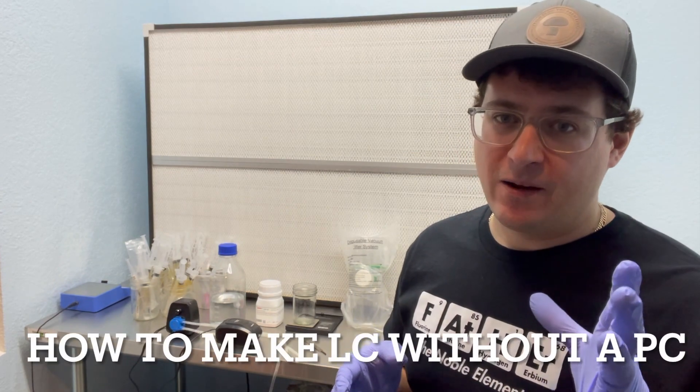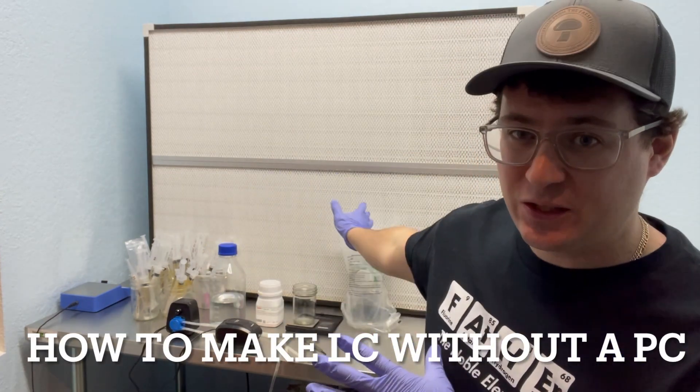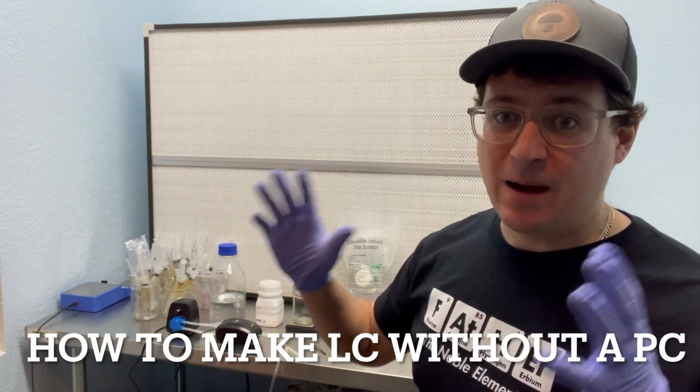What's up everyone? It's Gary with Fresh from the Farm Fungi. Today I'm going to talk about how to make a liquid culture without using a pressure cooker.